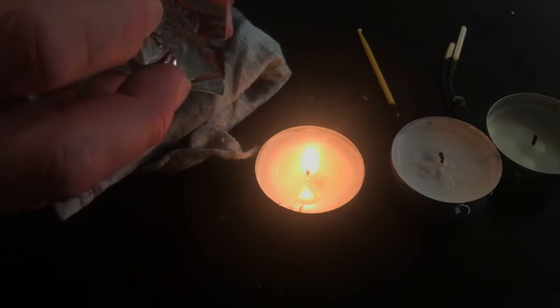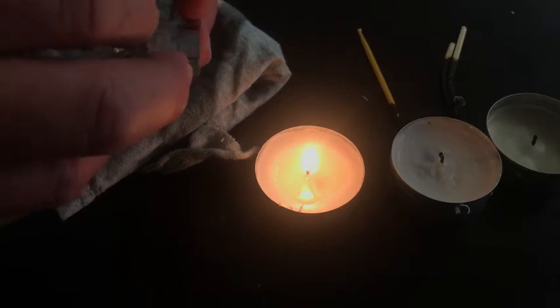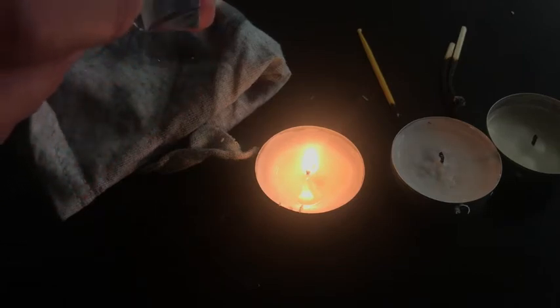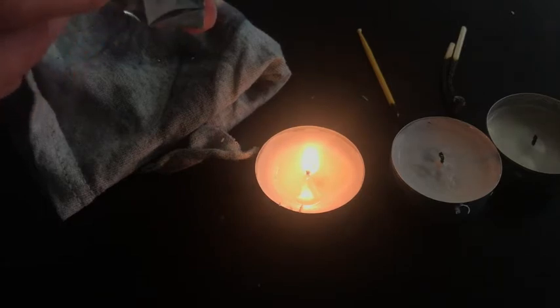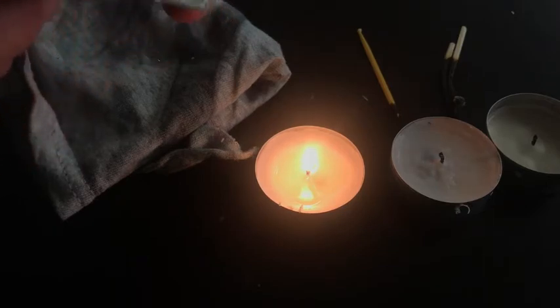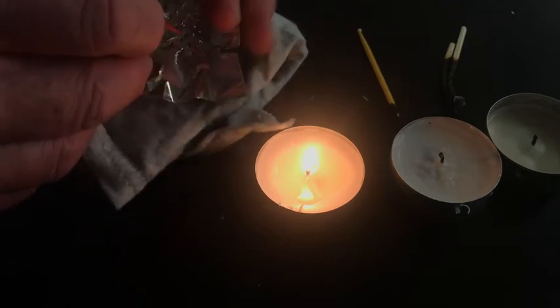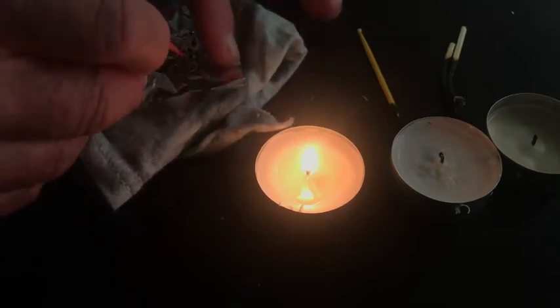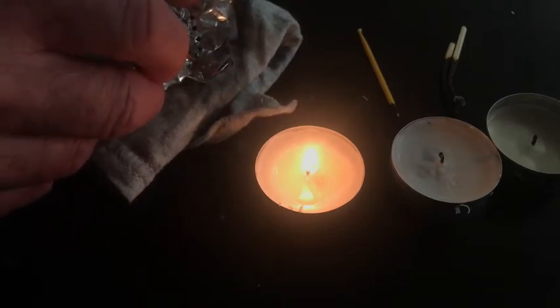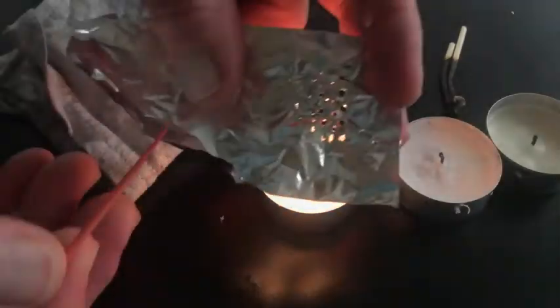I'd love to be able to see through it, so I'm actually going to make bigger circles in my screen so I can see through it. And if you accidentally make the hole so big that you combine holes, it's unlikely to be a problem. So here I'm enlarging all my holes. I see a place where I probably could have another hole there. And that one wasn't very big. I think I can get a hole in there and there. So you make a screen that you can see through.